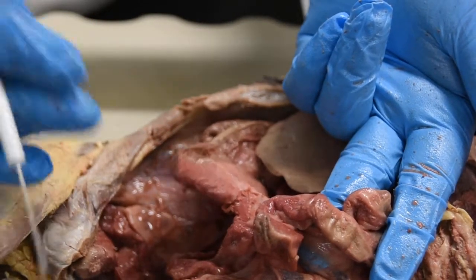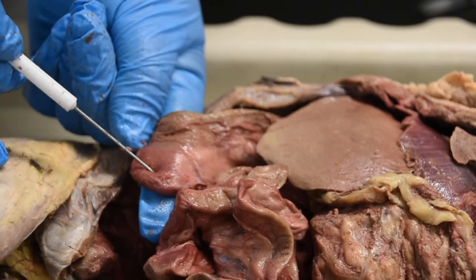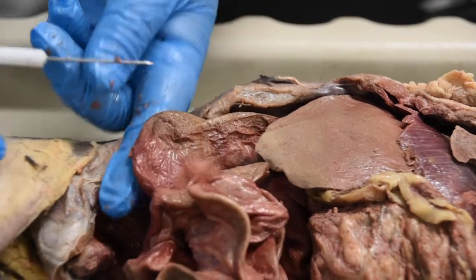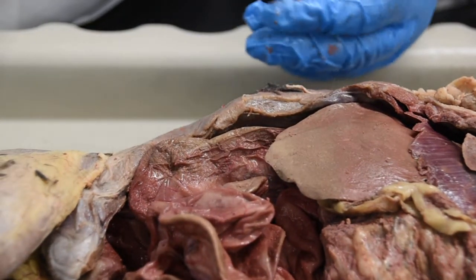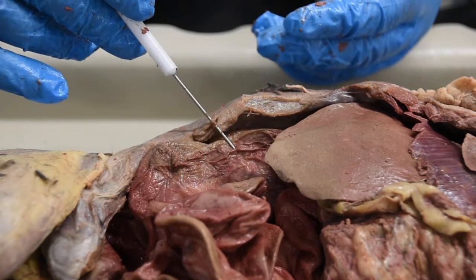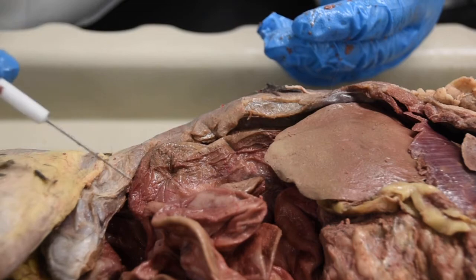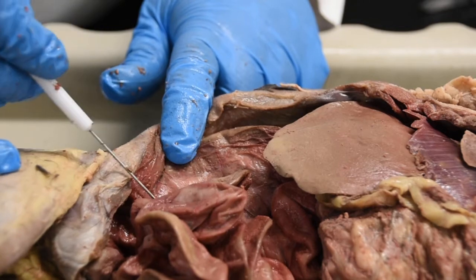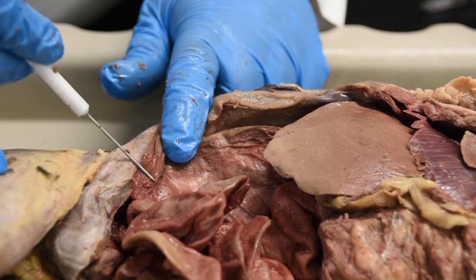This little sac you see right here, what I'm holding on to right now, see the sac? That's the cecum. And then going up, that's the start of the colon or your large intestine. I do not expect you to identify the ascending, transverse, descending or sigmoid colon. All I want you to be able to say is that this thickness identifies the large intestine, and that this little pouch forming here is your cecum. This part is identified as ileum because the ileum connects to the cecum.